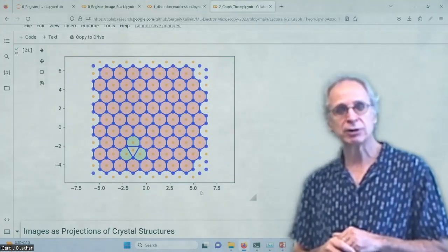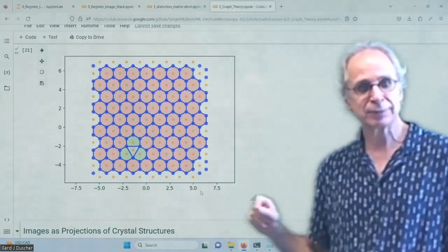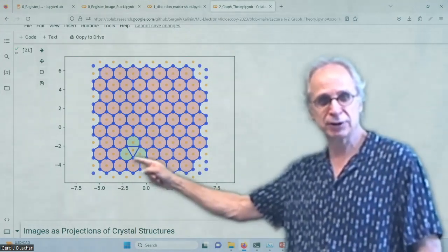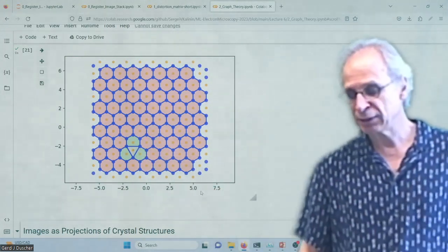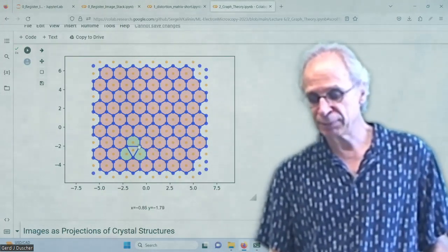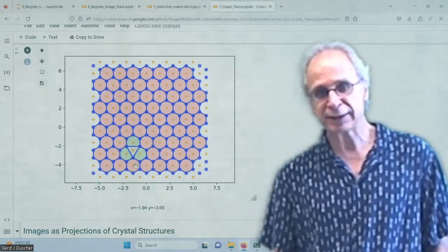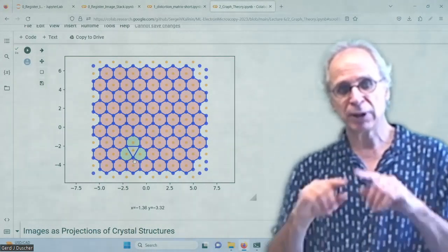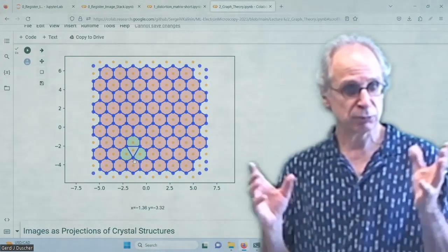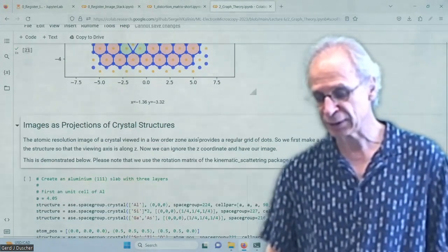How does a vacancy look like? Well, if you don't relax your vacancy, you will get a triangular feature here in 5-fold rings. That is due to the convex part, right? If these atoms, as they should, relax in and out, you will actually have a convex one, and then you will have a 9-fold ring here. So depending on that.